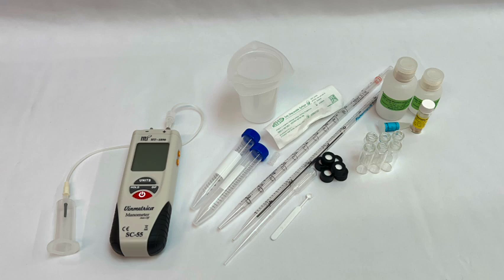For additional information, we recommend reviewing our blog and our troubleshooting guide. The reagents included in this kit are shipped with cold packs and need to be stored in the freezer upon arrival.